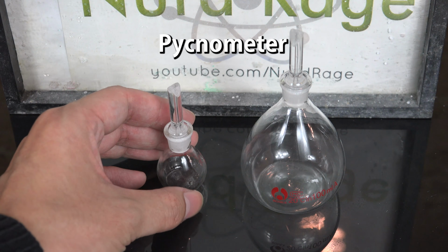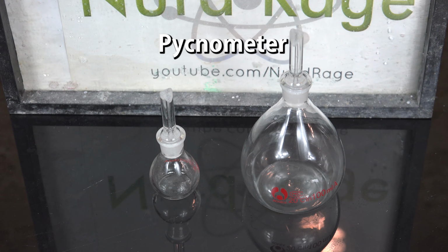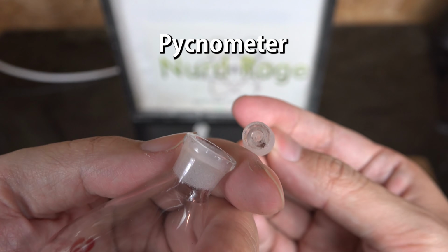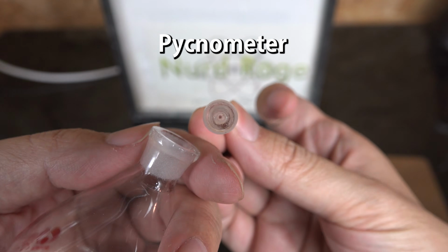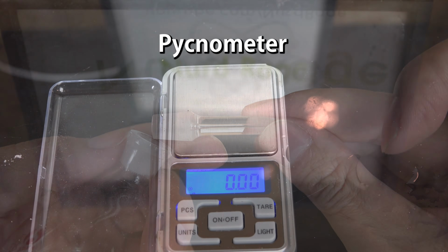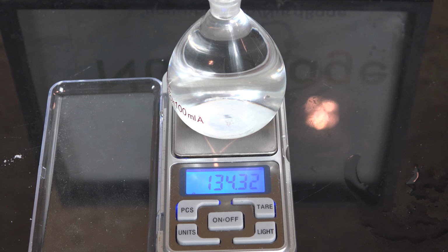They are specialized tools for measuring density, but they're just fancy flasks with fancy stoppers. The only thing special about them is that the stopper has a tiny hole bored all along the shaft. This lets air bubbles and excess liquid escape. The whole point of the pycnometer is just to be a super precise volumetric flask to give you a highly reproducible volume of liquid every time.